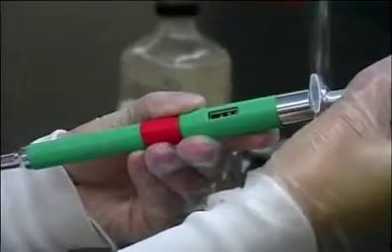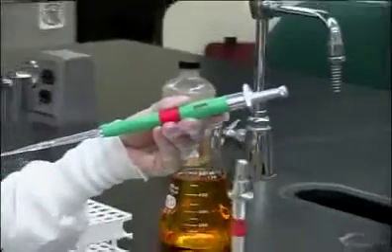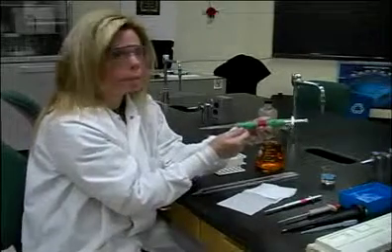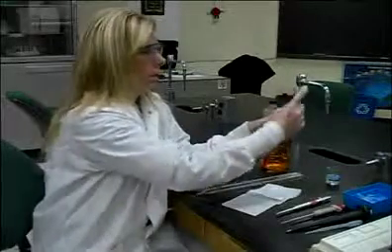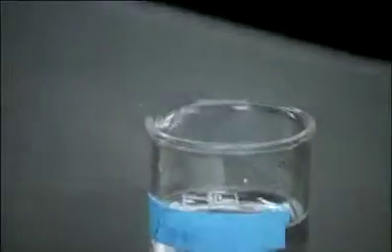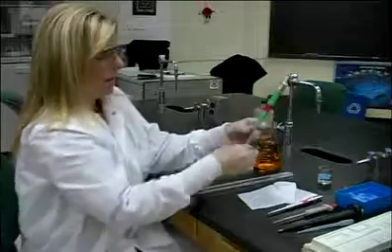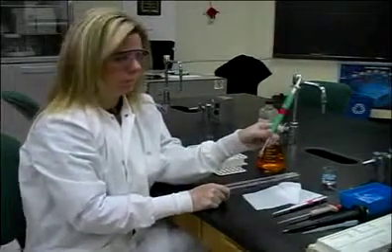So I can be more precise in my measurement as opposed to this MLA pipette where I am stuck with 3 choices. Here I have choices from 10.1 to 49.9 microliters. And this works basically the same way as our silver MLA pipette worked. You're going to just push down the plunger again, put it into your sample, dispense after you've wiped your tip into the test tube, and then discard the tip and go on to the next sample.